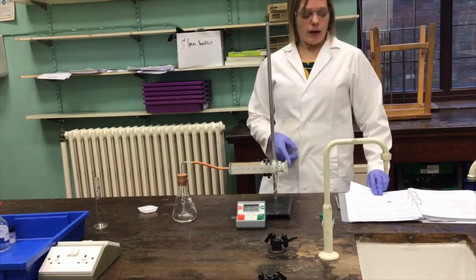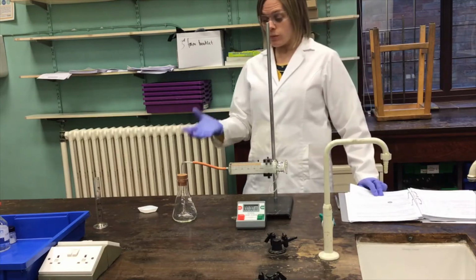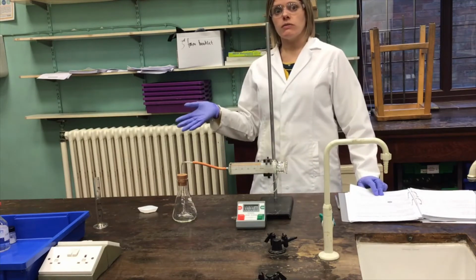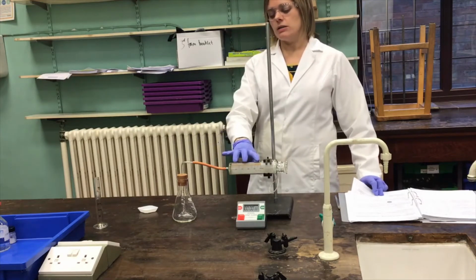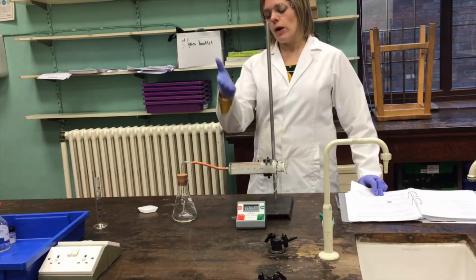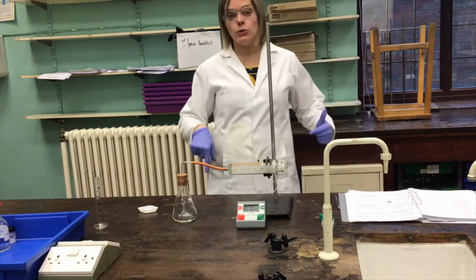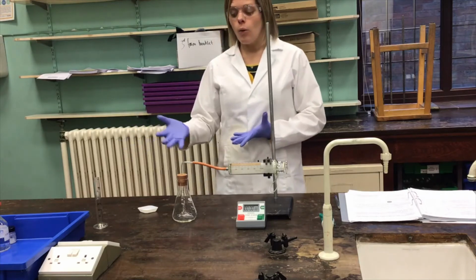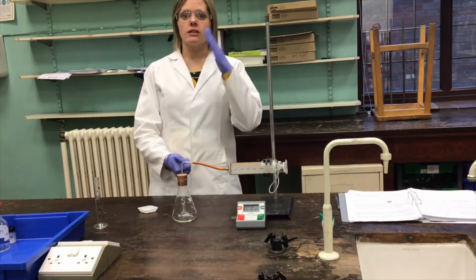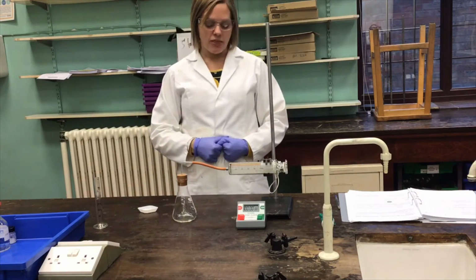In experiment A14, the idea is to use continuous monitoring methods to deduce rates of reaction. By continuous monitoring methods, we need something like this piece of apparatus here, the gas syringe, where we could take measurements at different points in time, continuously running the same experiment, as opposed to an initial rates method, where you might take one data point and that's it for that experiment. So this is a continuous monitoring method.